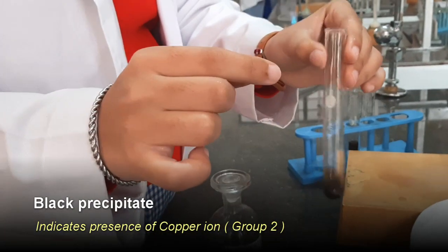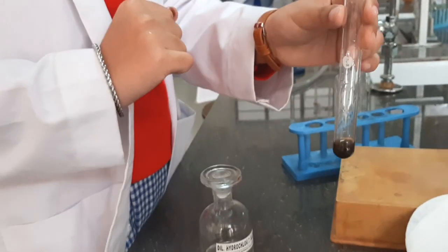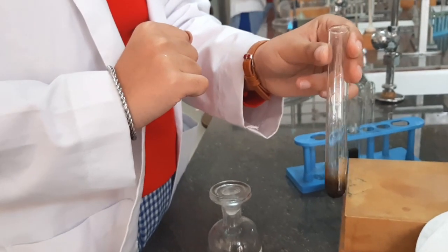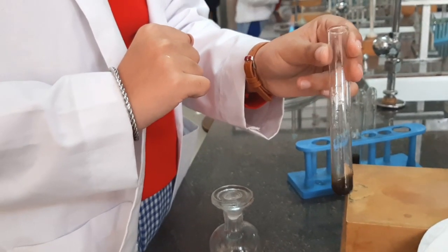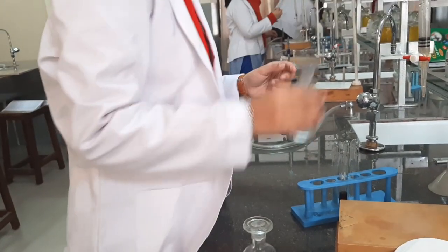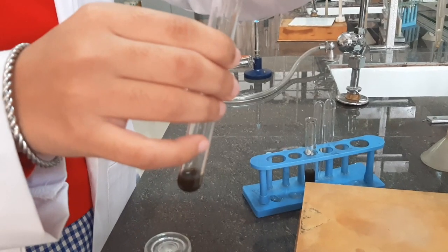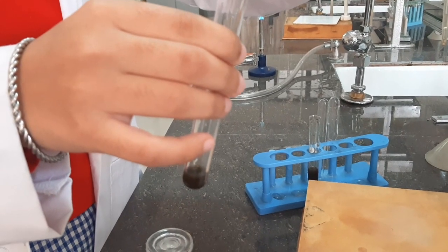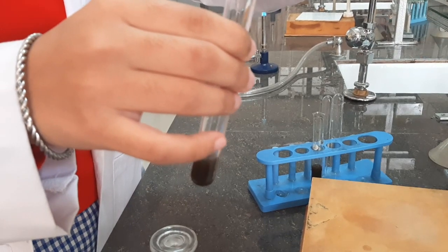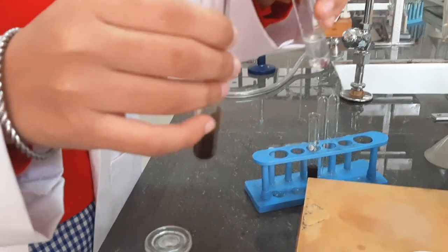Separate the precipitate and add 50% nitric acid to this and boil. Add 50% nitric acid and boil.